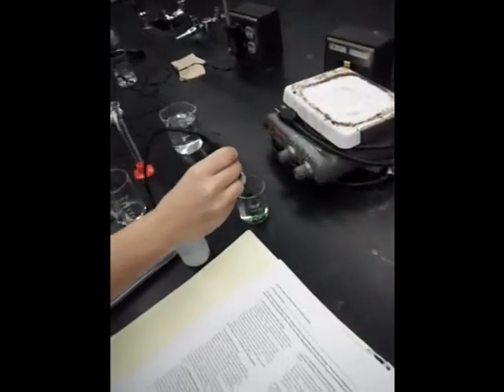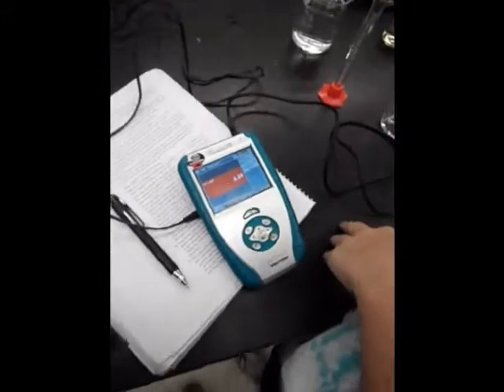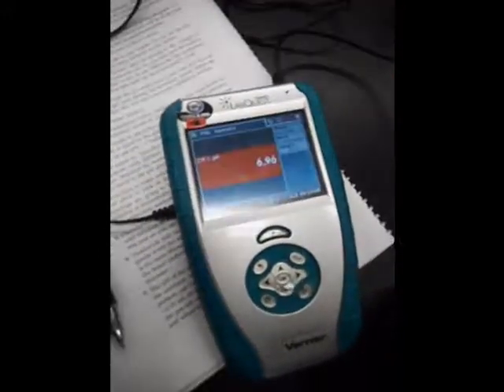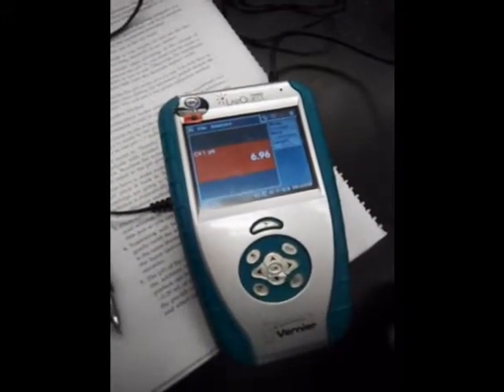Put it in the buffer 7 solution and wait to see if it's reading properly. It should read at 7.